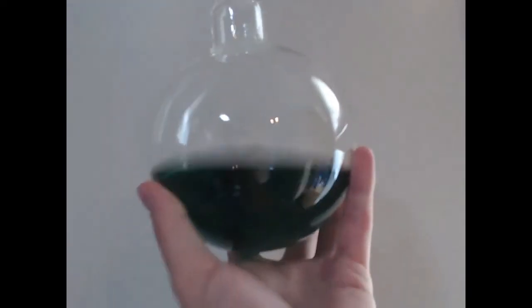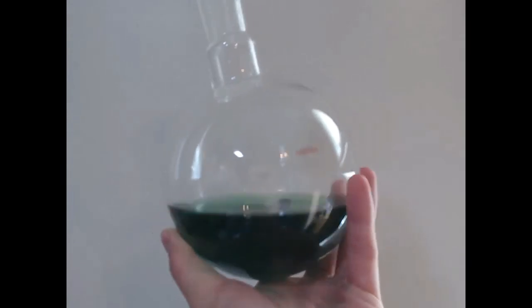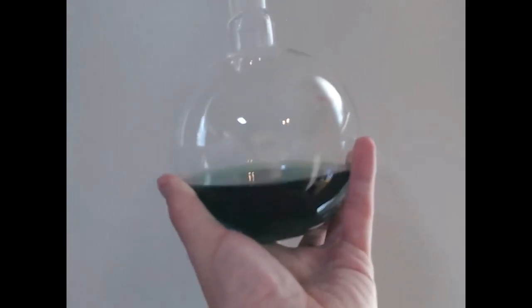What remained in the flask was the green food coloring and the water. Because we removed 250 milliliters of water, we can see that the water has gone a darker shade of green.